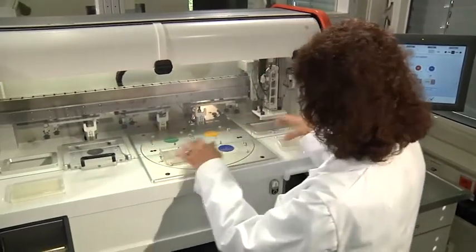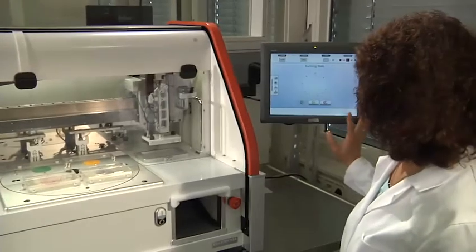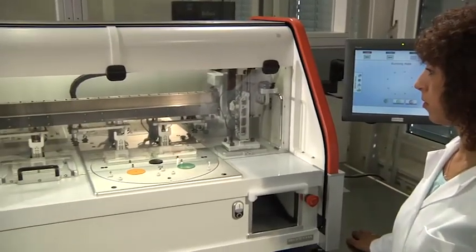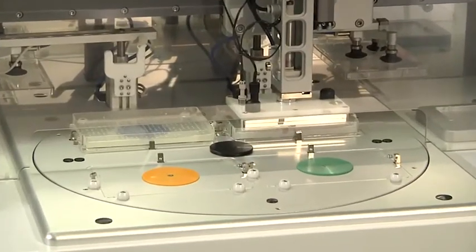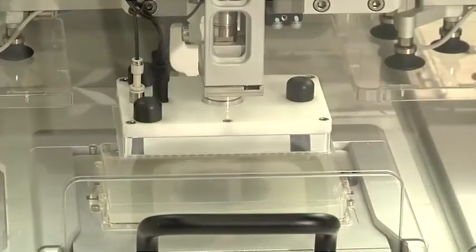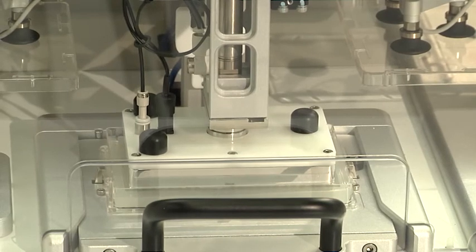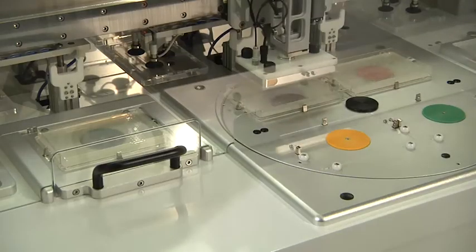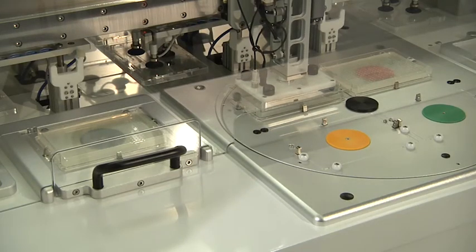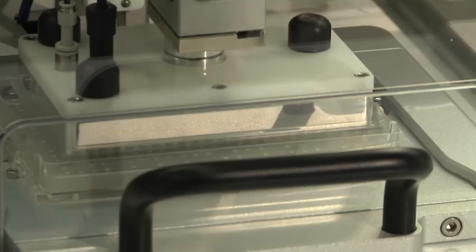In the so-called synthetic genetic array analysis, we examine if the combination of two mutations or gene deletions will lead to cell death or growth inhibition. For this screen, we first need to produce double mutants. The mutant strain on plate A with our gene of interest is crossed with all colonies on plate B, where each colony corresponds to a different deletion strain. The colonies from plate A are pinned and transferred onto a fresh target plate. Then the robot drops the used plate into the trash. Next, the robot arm positions itself over source plate B and pins those colonies as well. For the final mating, the robot arm moves to the target plate again and combines the colonies from plate B with those from plate A.